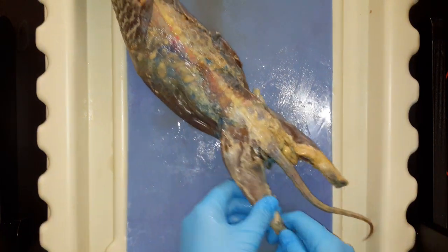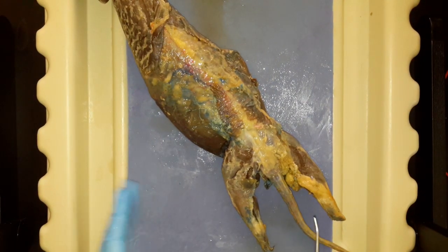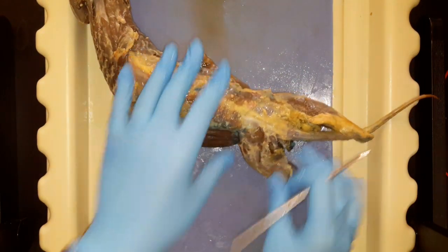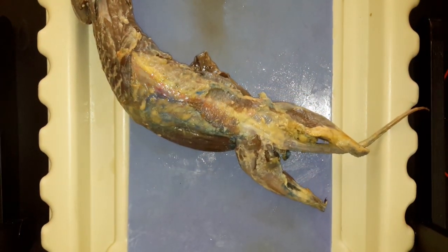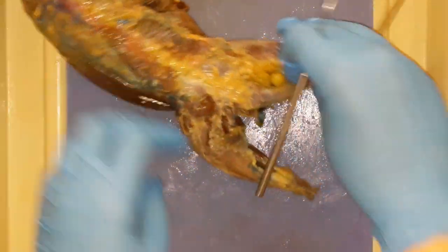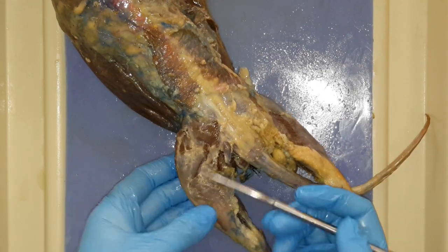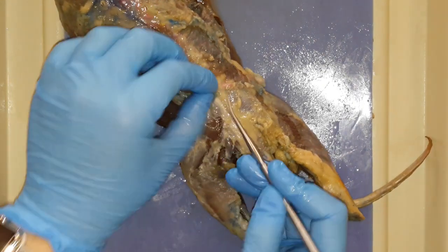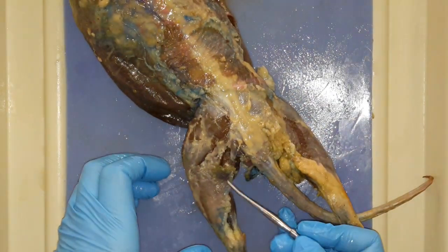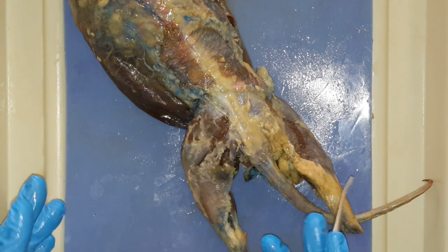Okay, so it is recording, and of course he's greasy as always. First, we're going to look — let's see if we can identify some of these muscles. Zoom in, touching the dirty screen. Back leg. So this is the lateral side of the leg. Most of the muscles are pretty well cleaned. It's not expecting it to be perfect, and I know a lot of you have some random cuts from the preparation or skinning process, and that's unfortunate.